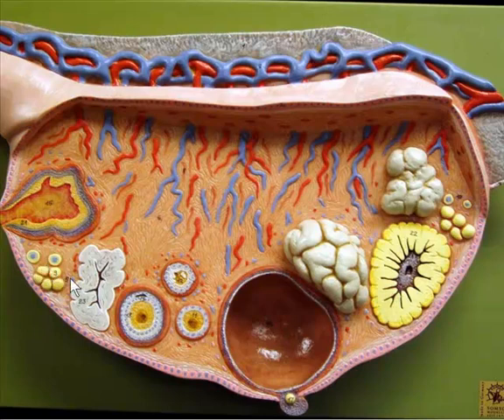Now remember that the follicles are going to be the oocyte that we see like here in brown, in this case like with a primary follicle. So it includes the oocyte in the center as well as the follicular cells around the periphery. So we've got different stages. We've got the primordial follicles here. These are the ones that are basically in stasis. We've got primary follicles basically here and here, where we see the oocyte is much bigger, and now the surrounding follicular cells are also much larger. And then we have a secondary follicle here.